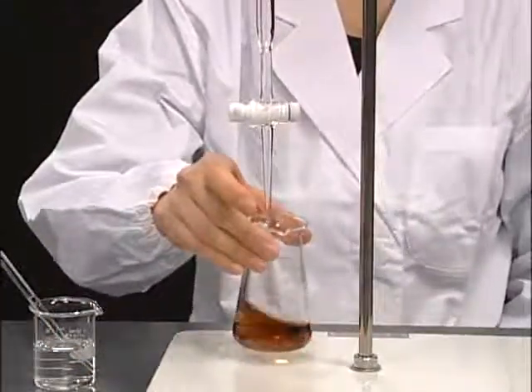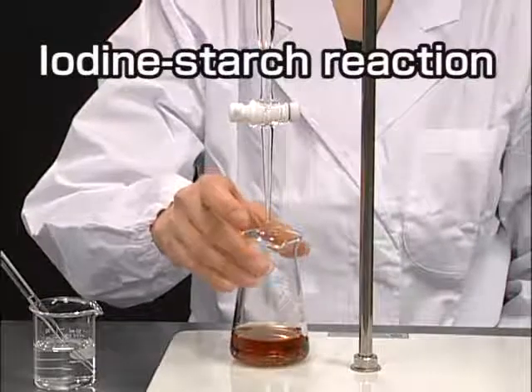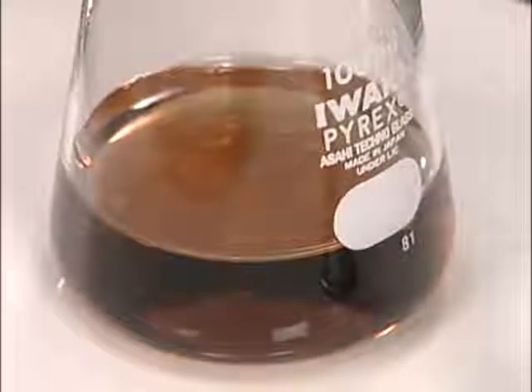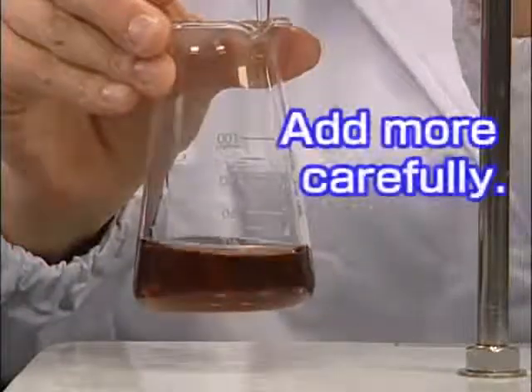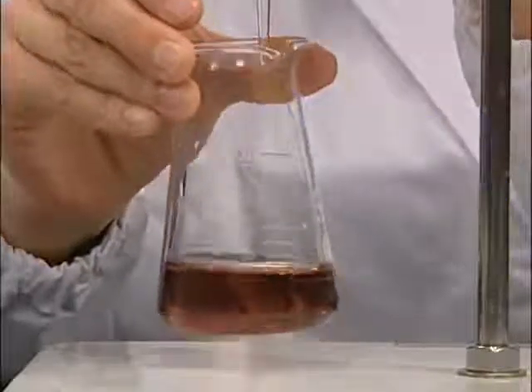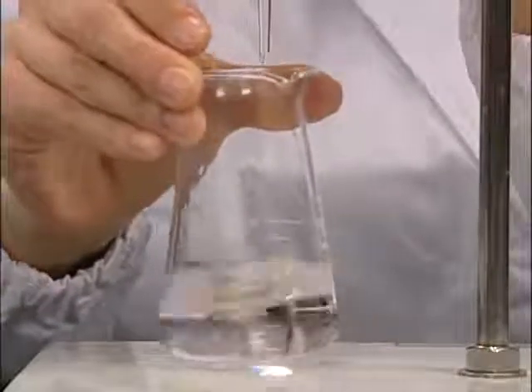The color of the reaction solution turns deep due to the reaction of iodine-starch. At this point, the titration reaches almost the end point. Hereafter, you should add the titrant more carefully. When the solution turns colorless, it is the end point.